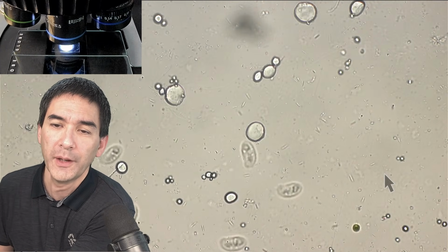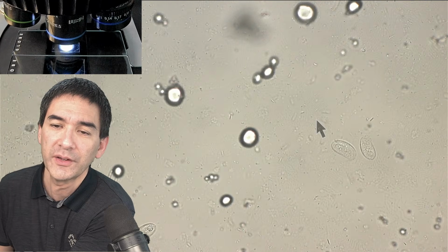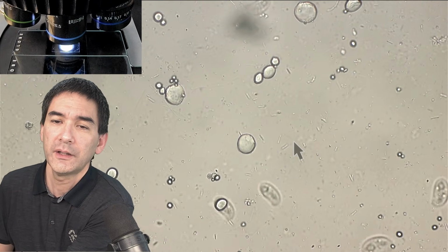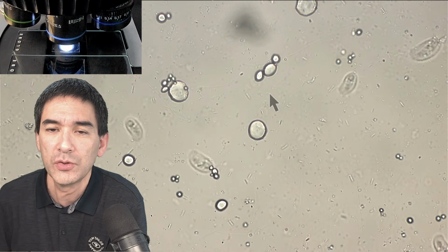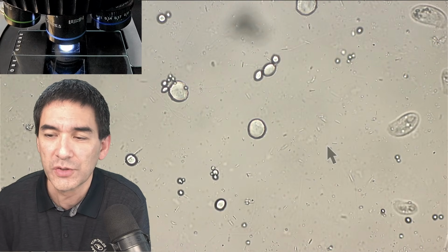As a rule of thumb, the volume of one of those ciliates is around 1,000 times larger than those bacteria in the background. Yeah. And that is something that you can see quite commonly, but sometimes people just ignore those bacteria in the background because they're simply too small, right?